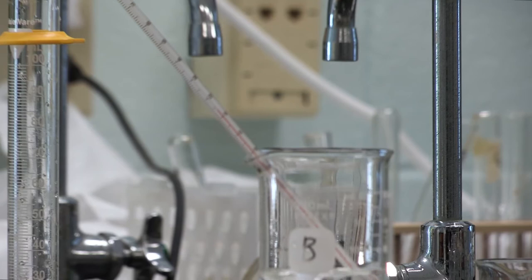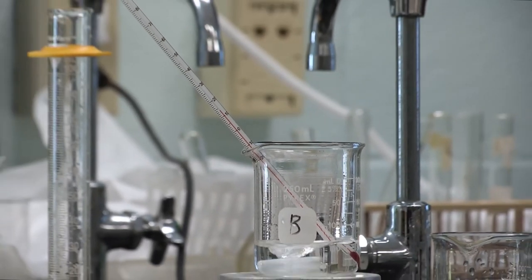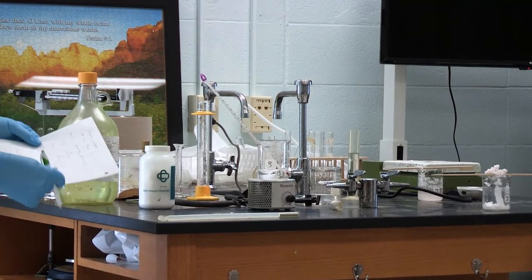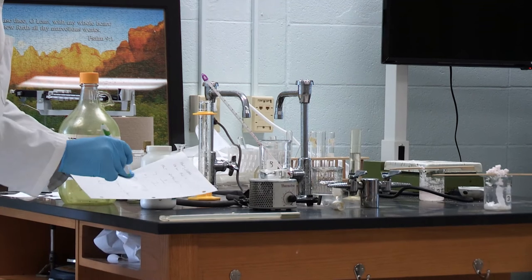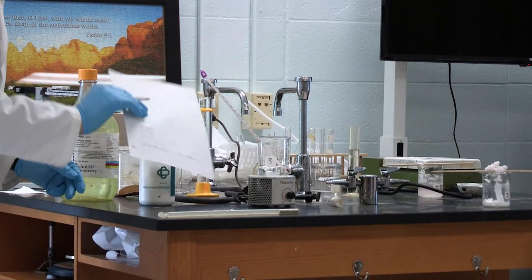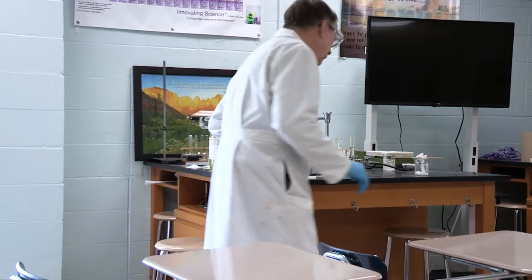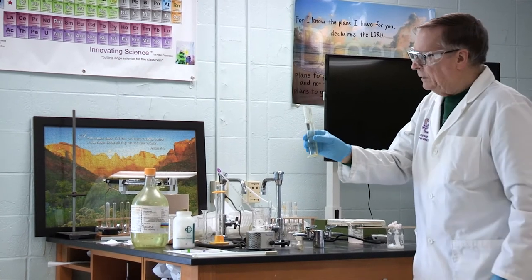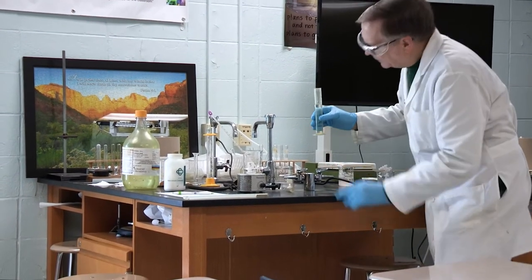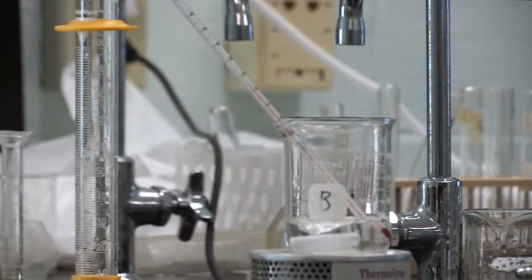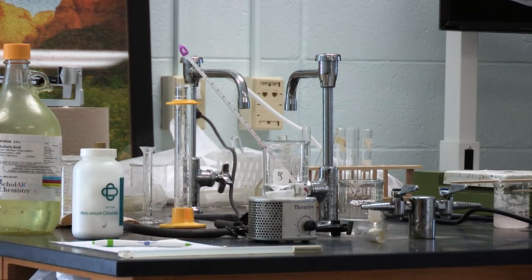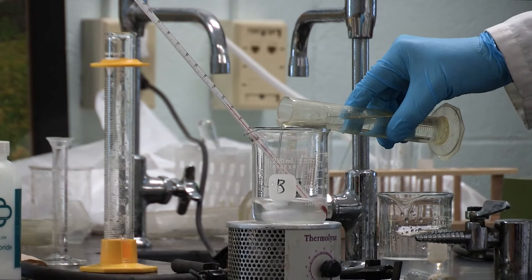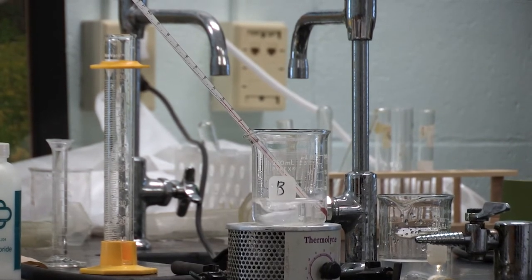Let's see what our starting temperature is. Earlier today it was 20, but right now it's still cool from the last one. So I've got 14. I went ahead and poured out the sulfuric acid for you. This is room temperature now. The water and the sulfuric acid are the same temperature. Watch the thermometer. I'm going to add 5 milliliters at a time. I'm at 50, so I'm going to add 5 milliliters. There's 5 milliliters.